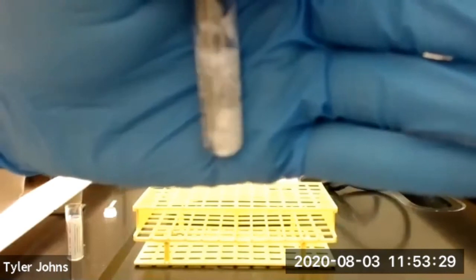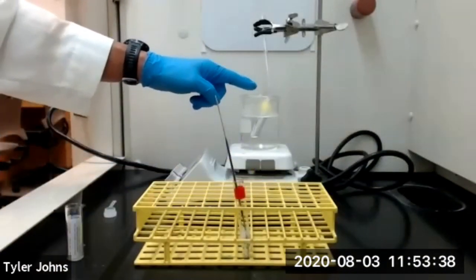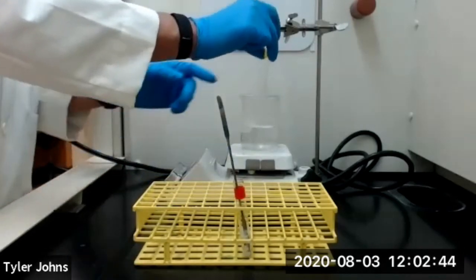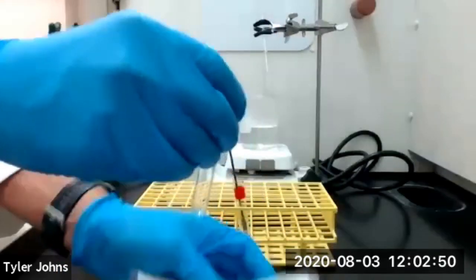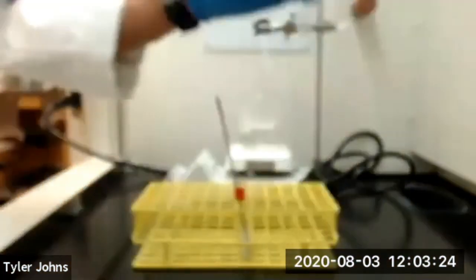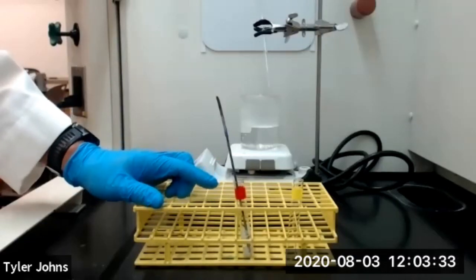What we'll do next is wait for our bottom layer solvent to evaporate from the test tube in our hot water bath to confirm that there's no solid compound in our bottom layer. Our bottom layer solvent from our original test tube has now completely evaporated from the test tube that we transferred it to while in the hot water bath. And this is the result from the evaporation of that bottom layer solvent. You'll now need to explain why we performed the procedures we did in this experiment and whether the results of those procedures are consistent with your original predictions.